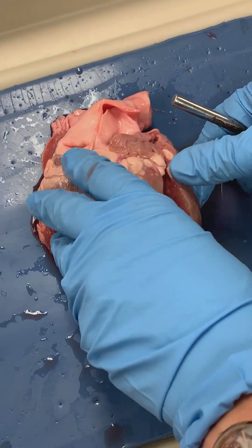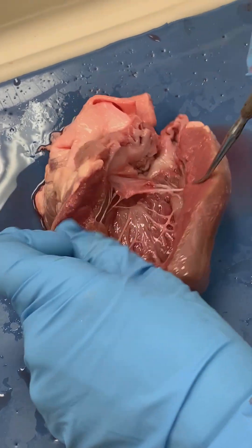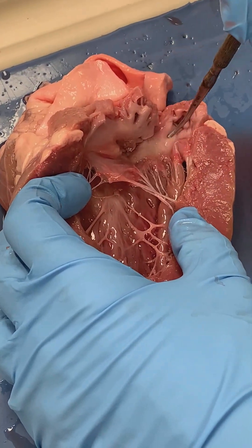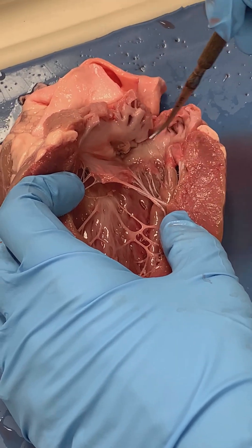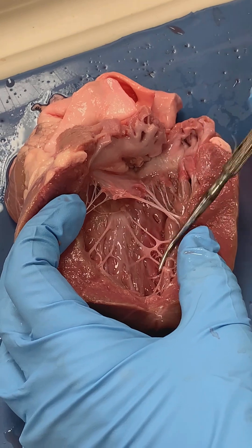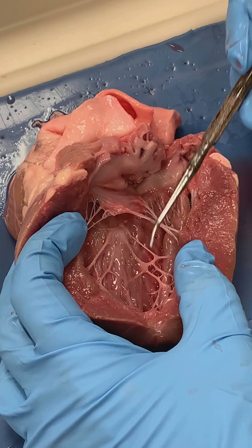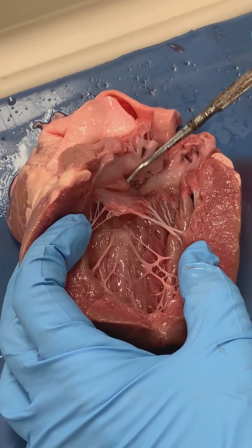Opening that cut, we can now see the inner surface of our left atrium and the inner surface of our left ventricle. You can think of these as rooms.